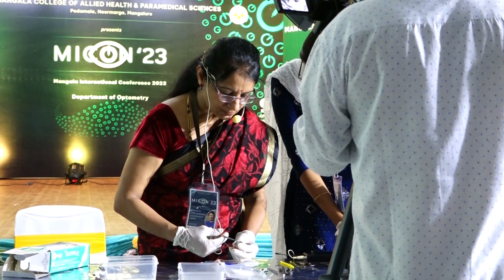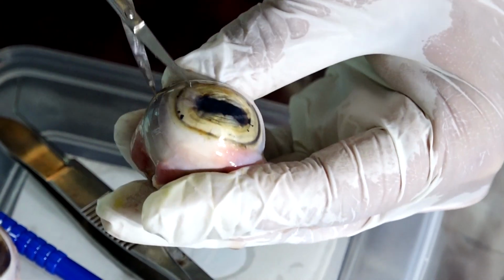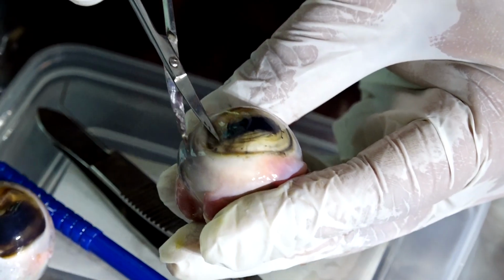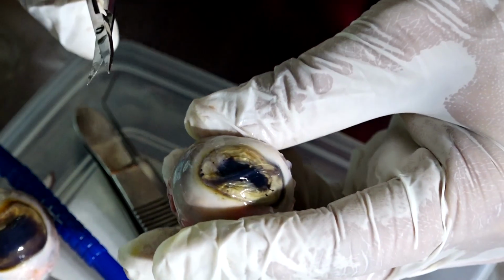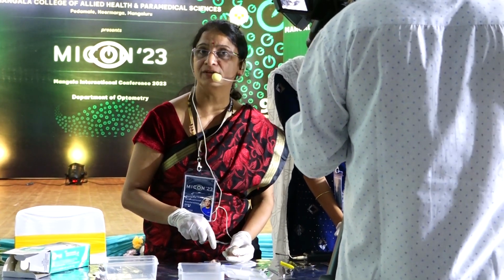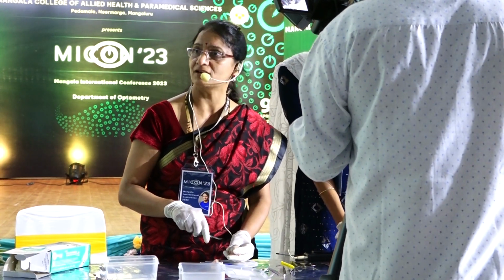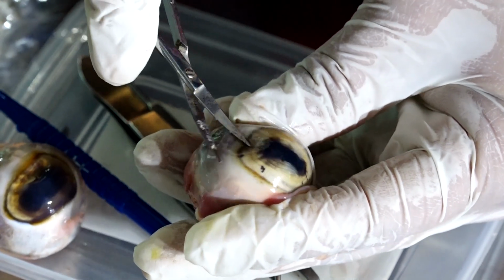So, shall we now look at the different structures? We'll just make a cut over here and try to enter the cornea, anterior chamber completely. So once it opens, it's very difficult for a surgeon to suture also because the pressure inside the eye is very low. We need a tense eyeball to suture well. But here now it is very soft because I have already entered and the aqueous has come out.